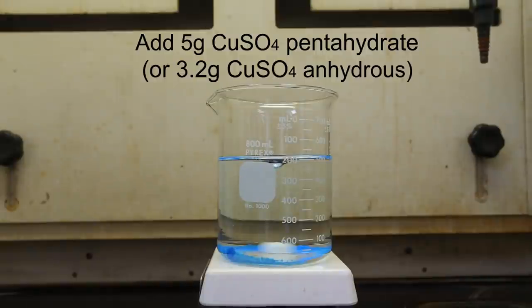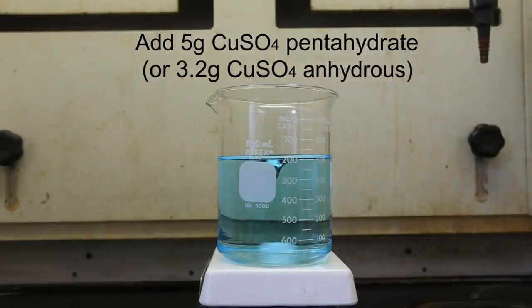First, add about 5 grams of copper-sulfate pentahydrate to about 500 milliliters of water. I only had copper-sulfate pentahydrate available, however, you can use anhydrous copper-sulfate instead. If instead you have anhydrous copper-sulfate available, simply dissolve 3.2 grams instead of 5. The anhydrous copper-sulfate is significantly more soluble in water, and a lot less water is needed. Stir the copper-sulfate until it has all completely dissolved into the water.